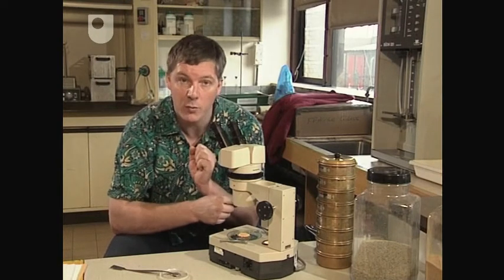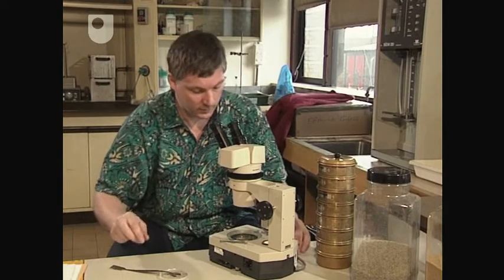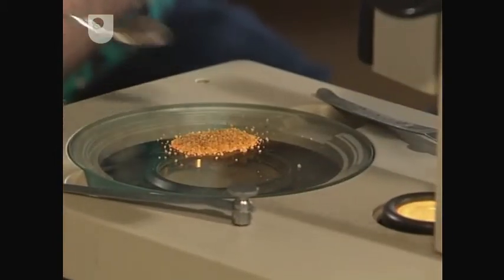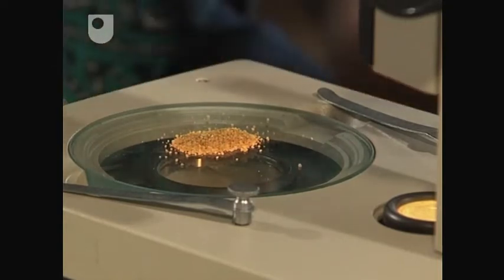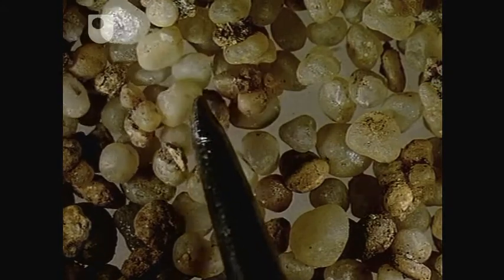I have another sand here. Let's have a more careful look at that one. This is quite different. But what about this reddish surface colour we've got here? Let's take a more careful look at that. It certainly appears to be just a surface coating with the red stuff around it, so this appears just to be an iron oxide coating on some of these grains.